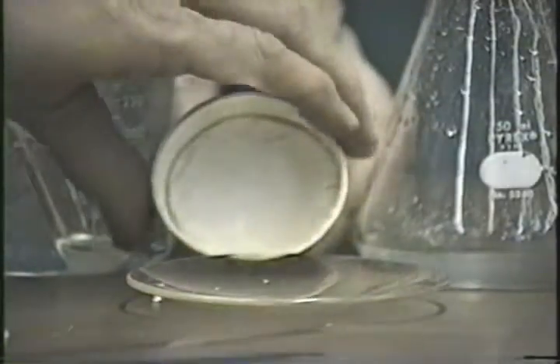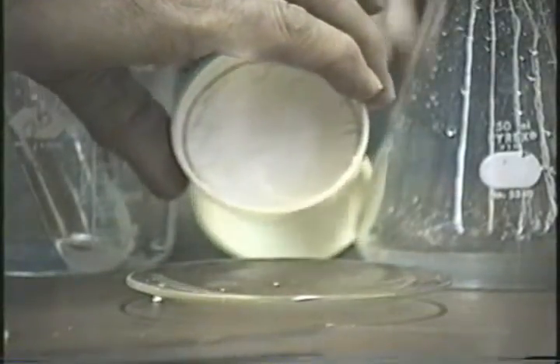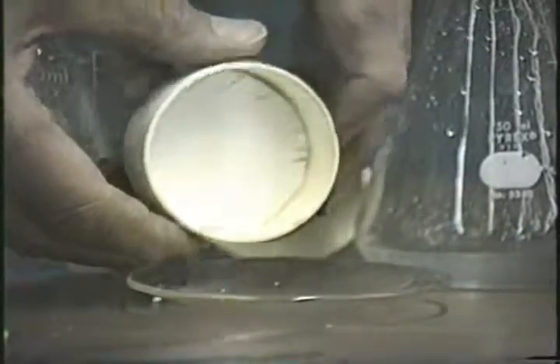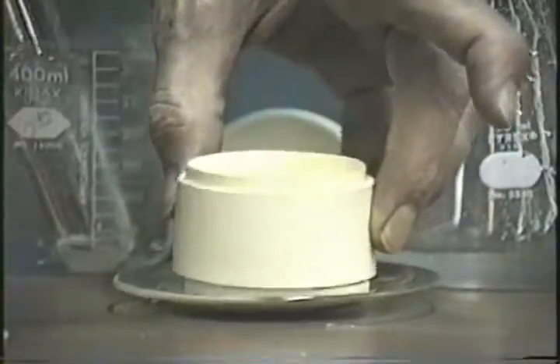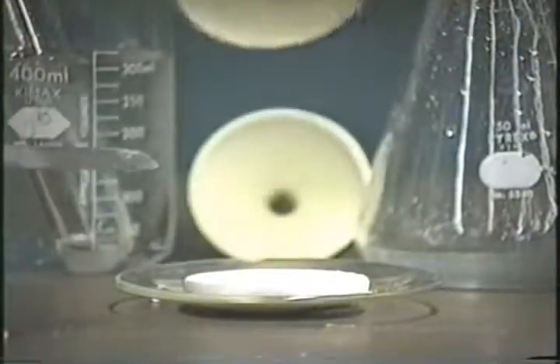To do that, what you usually do is break apart the Buchner funnel here. They come apart, that is, don't break it. And put it on the watch glass. To do that, just put this down here. Now, if it doesn't come out, this came out automatically, but if it doesn't, just take something and tap it a little bit. It usually falls out. If not, you may have to dig it out.